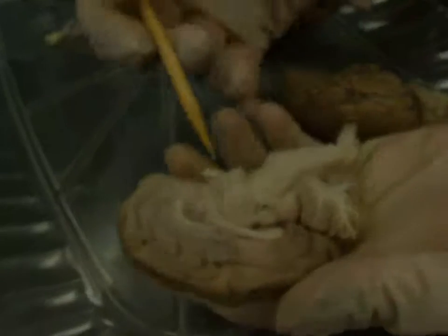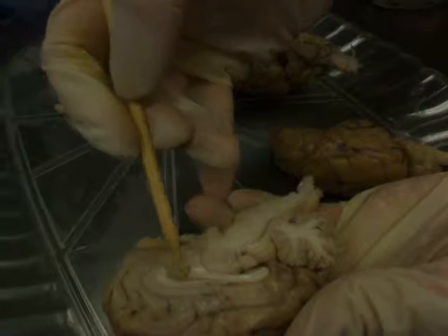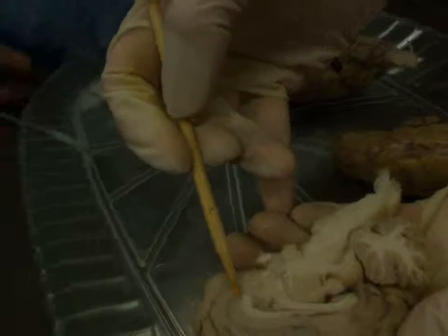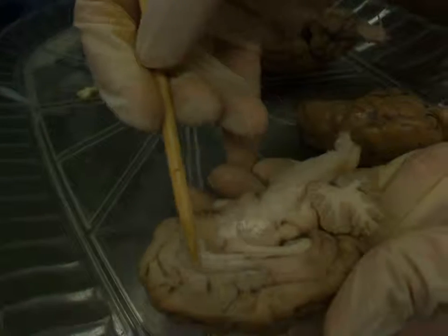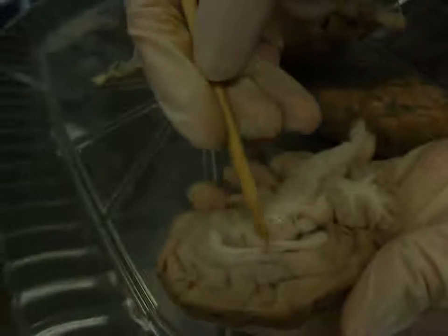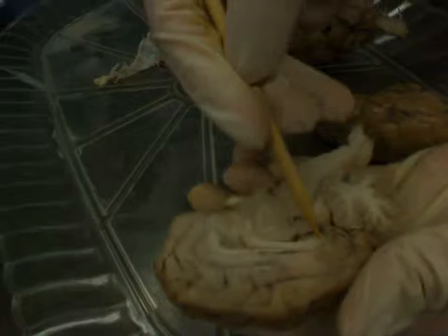So parts that we can see on the mid-sagittal cut, we can see cortex all around here. We can see the corpus callosum going across the top here. The portion of the cortex that actually wraps around the corpus callosum is known as the cingulate gyrus. The different parts of the corpus callosum include the beak here, the rostrum, the knee or genu, the body going across here, and then the bandaged part of the back, the splenium.